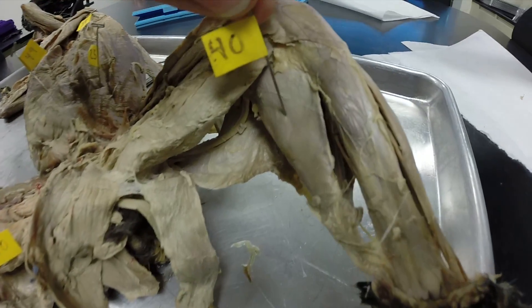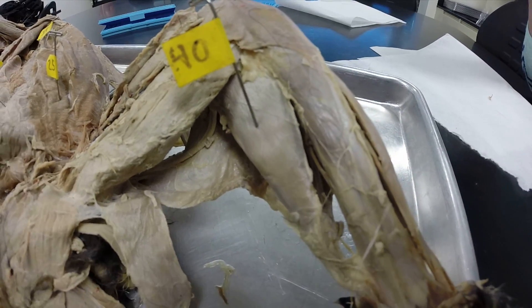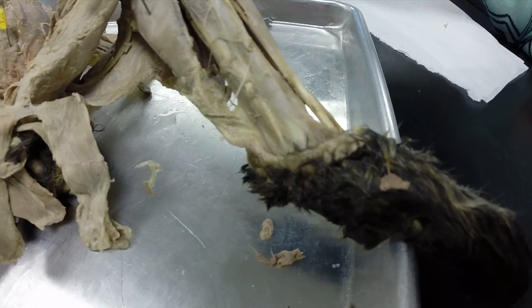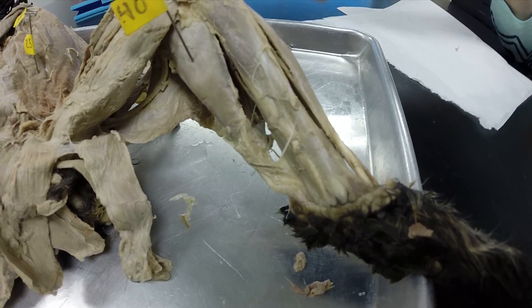What is this big muscle right here? That's the gastrocnemius. The check for that is to make sure it's connected to the tendocalcaneus down there. Hopefully that gave you a little bit of practice with the cat muscles.